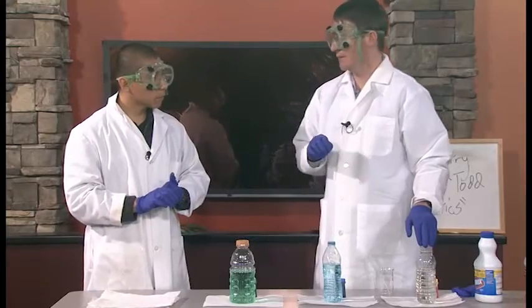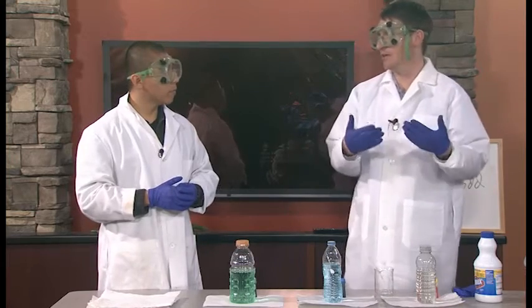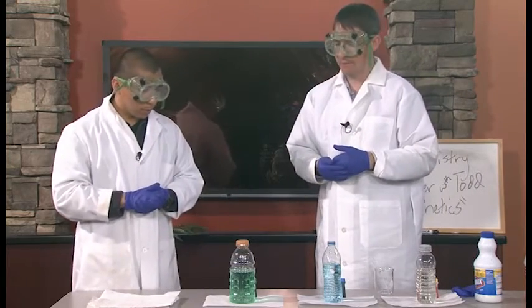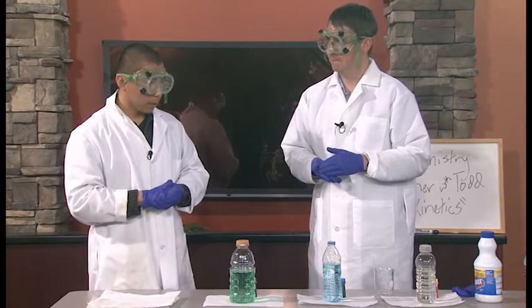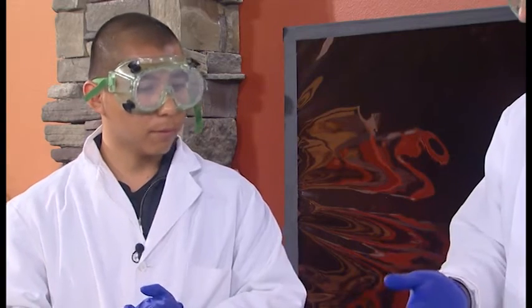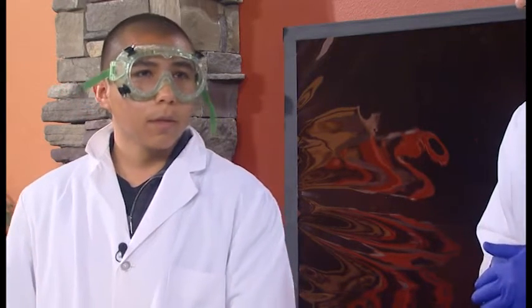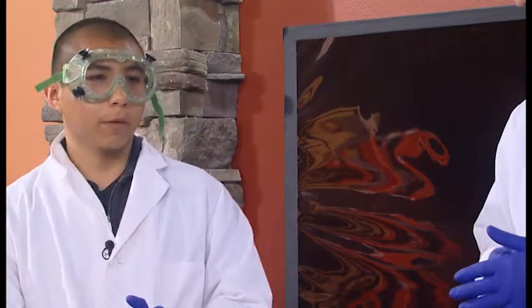So based upon these results, what we like to do in science is to make predictions as to what's going to happen in a third experiment. So if I add the same amount of bleach to the green solution, what kind of observations do I expect to happen? I would assume that it would take longer for it to become colorless. Okay, so you expect it to take longer to go colorless because you have maybe two colors in there. Do you expect it to go from the green to the colorless, or do you expect something else to happen in between, for example, go from green to yellow or green to blue and then colorless? Right, for example, yes. That could happen. I'm not exactly sure. That's very interesting.